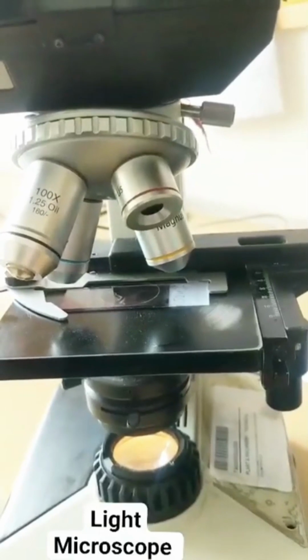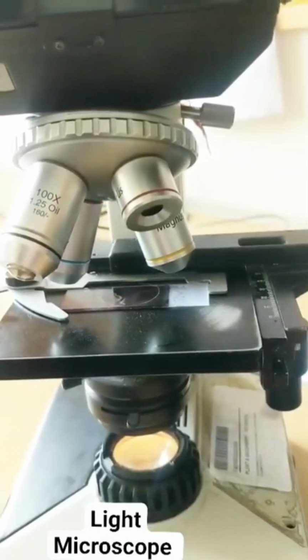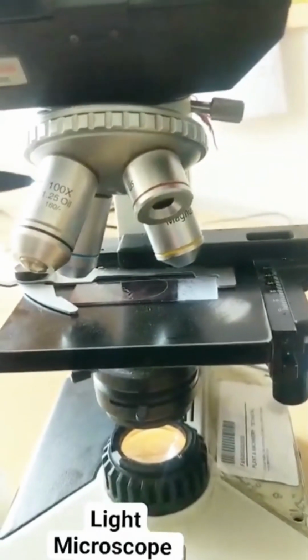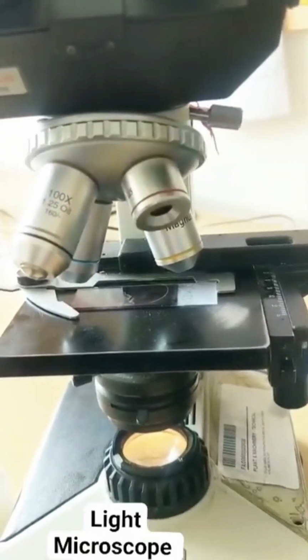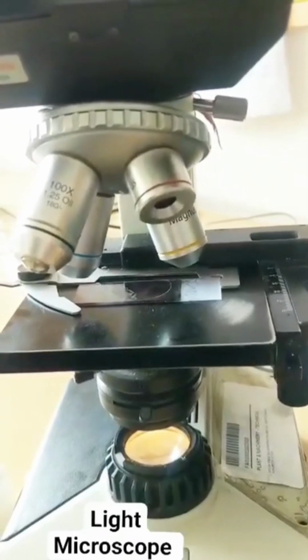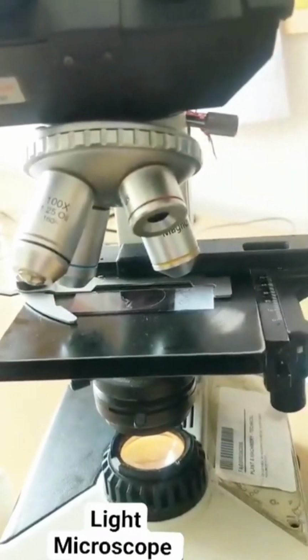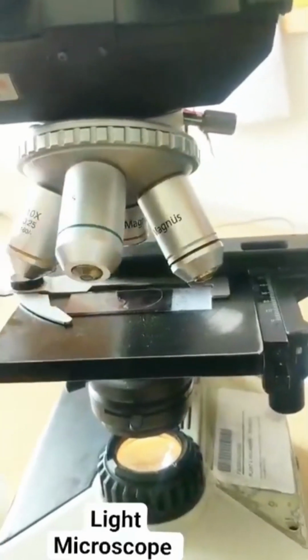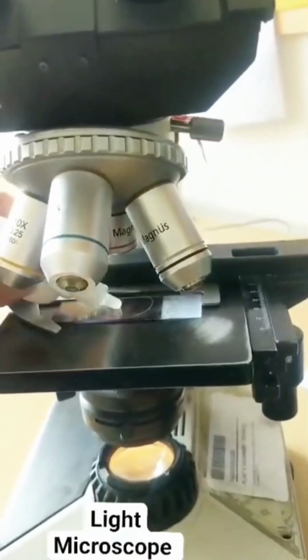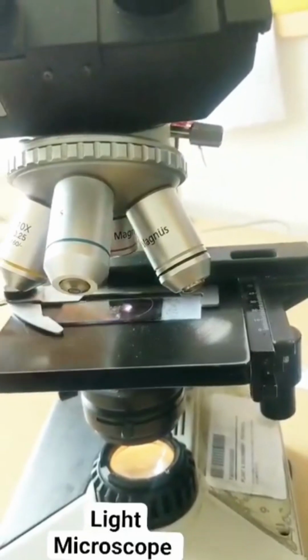So what are the 4 magnifications? 4x, 10x, 40x and 100x. And what is written on the 100x? Oil. This is the one that you will use when you have to see something in oil, like the hematology slides. So guys, what am I going to do? For viewing something in oil, first I will put a tiny drop of oil over here.